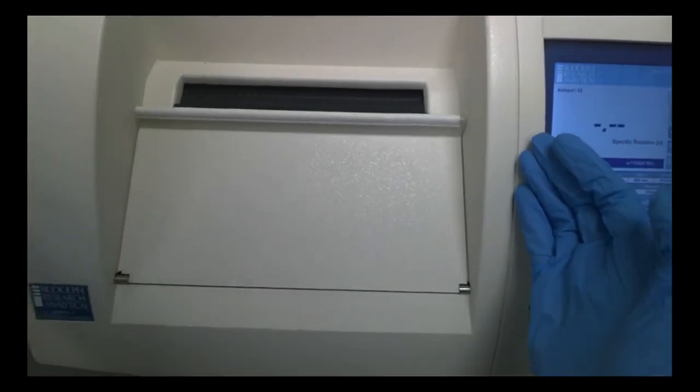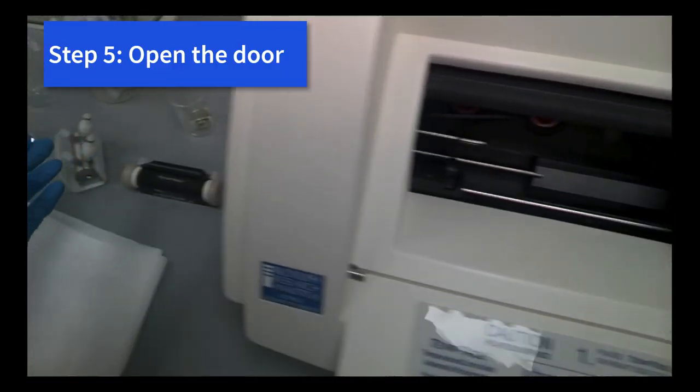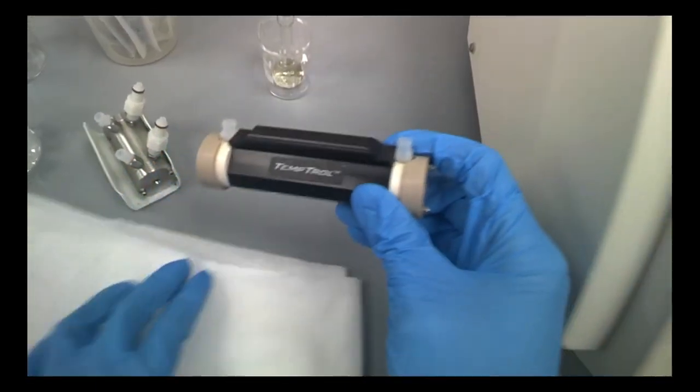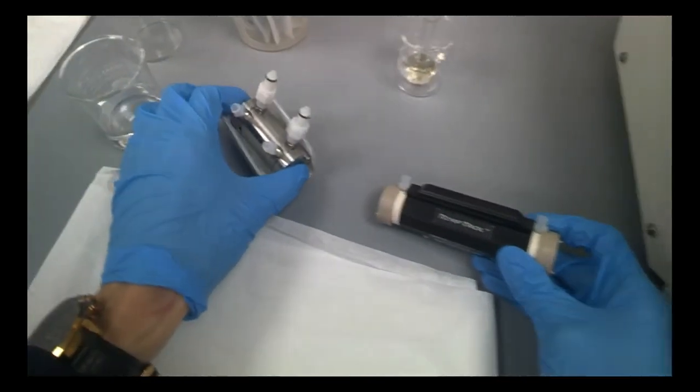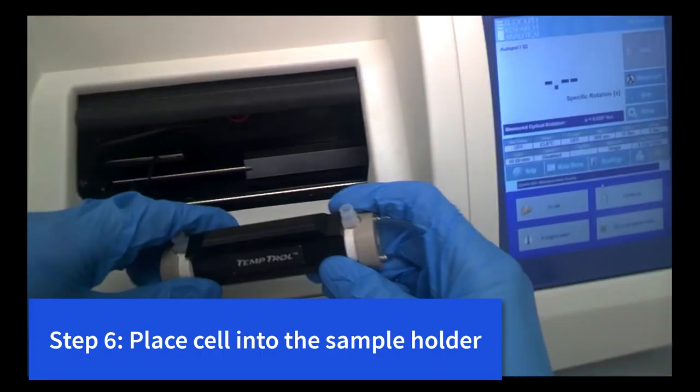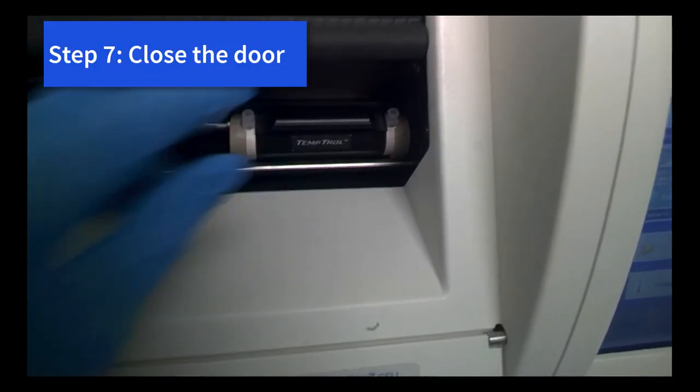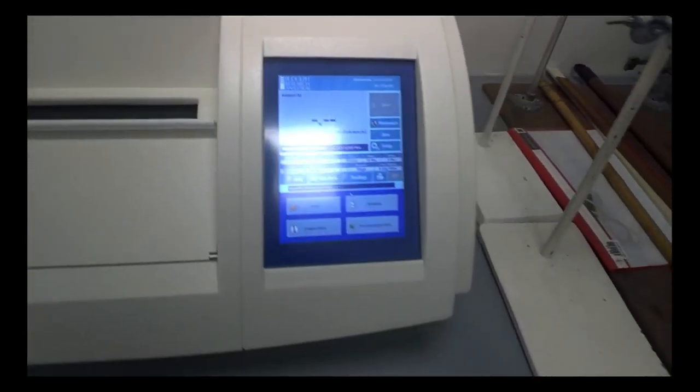Now you need to place a sample. Open the door and place a sample inside. As mentioned just now, you have two kinds of cells: the one that's temperature controlled with 10 cm path length, against the 5 cm path length cell. We can place it into the sample holder all the way to the right side nicely, and close. This is how it will work later.